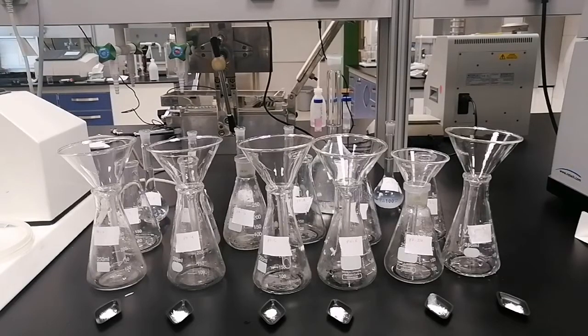We will have different methods to solubilize weakly acidic drugs, and we will talk specifically about mefenamic acid. One of the methods is pH modification. The second one is co-solvency, and the third one is salt formation.